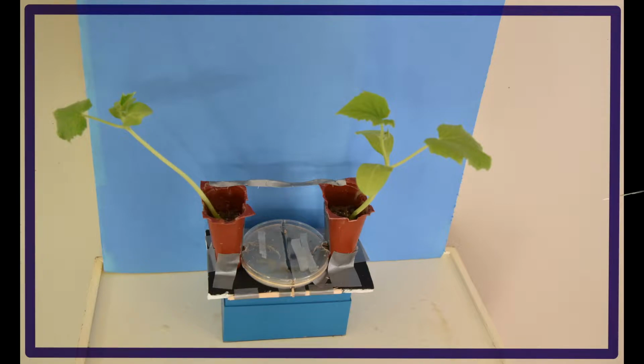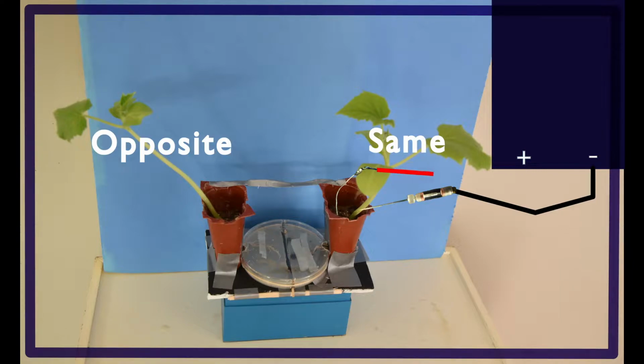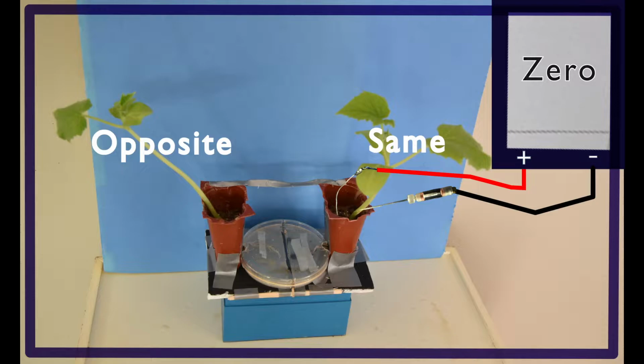A protocol for testing each setup is as follows. We denote the plant we are recording in with the title same, and the plant we are not recording in is denoted with the title opposite. Once we have established the electrode and ground are properly recording, with minimal noise and with no large anomalous spikes, we zero the voltage display.